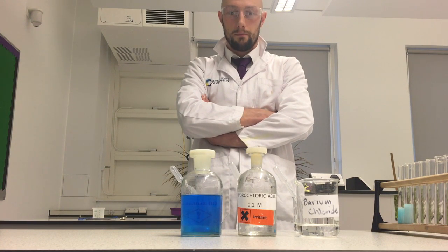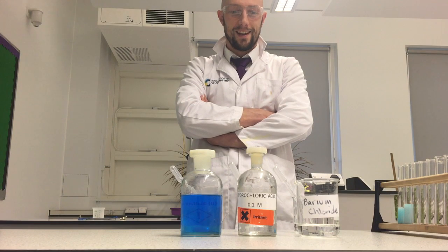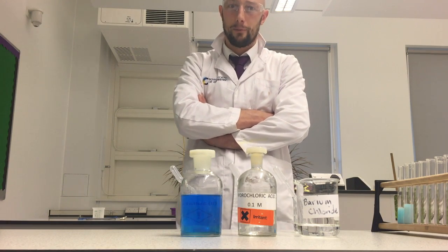So there you go, I've actually explained both there, the sulfate test and the carbonate test. Fantastic little bit of analytical chemistry.